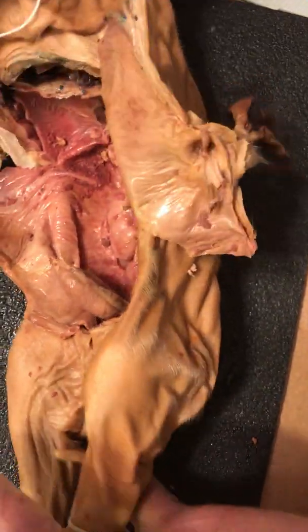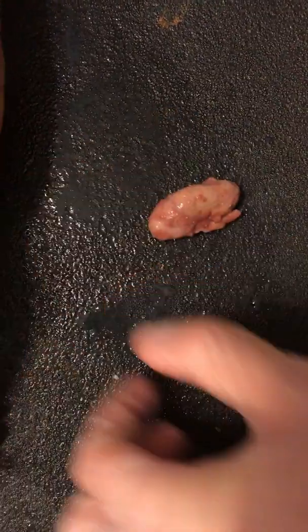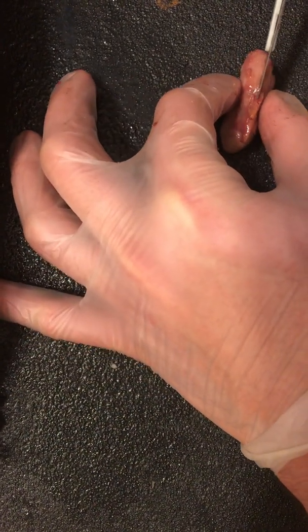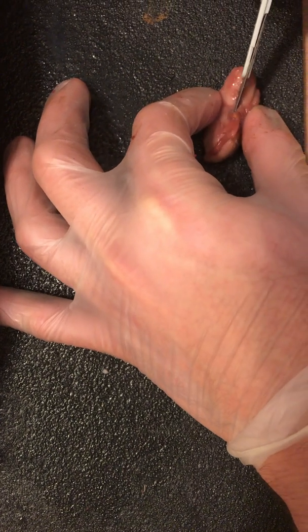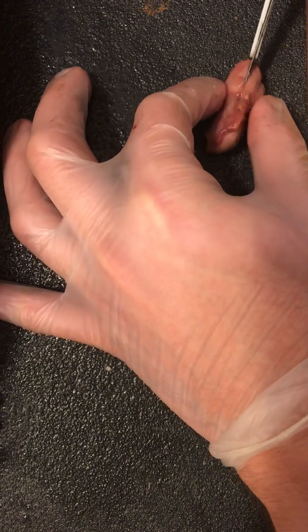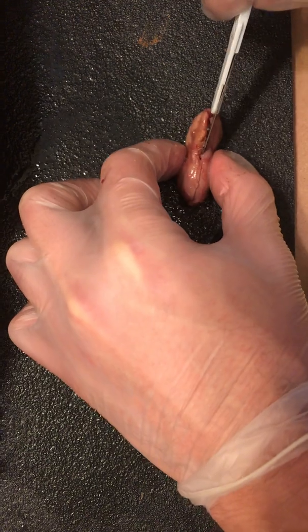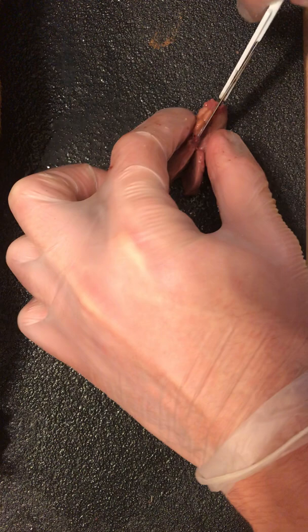We're going to scoot our little piglet over here. The last part of our dissection is going to be to dissect the actual fetal pig's kidney itself. We're basically going to do exactly what we did with the sheep kidney. Oh my god, things are coming out of it. It looks like a bunch of gooey liquid is coming out of my kidney. I hope that's not something important, of course.